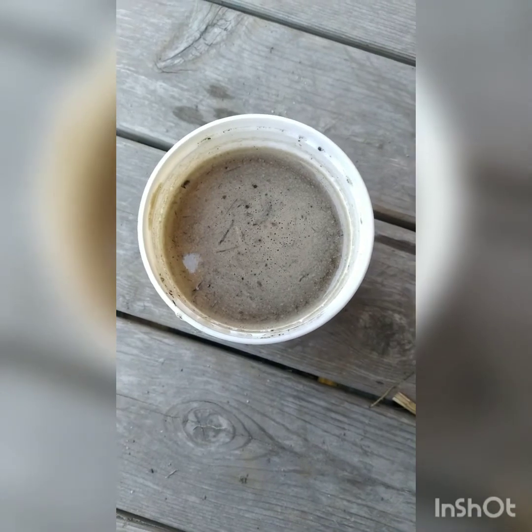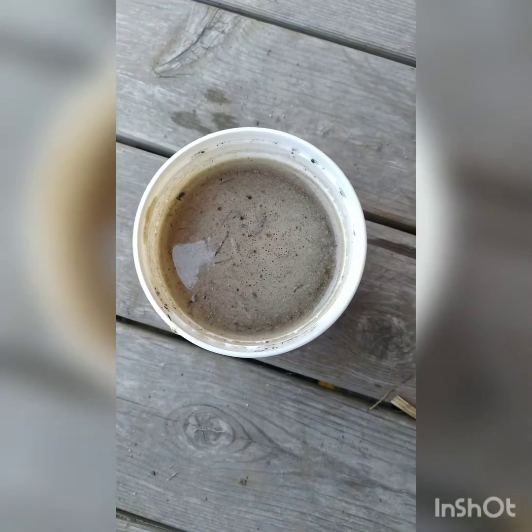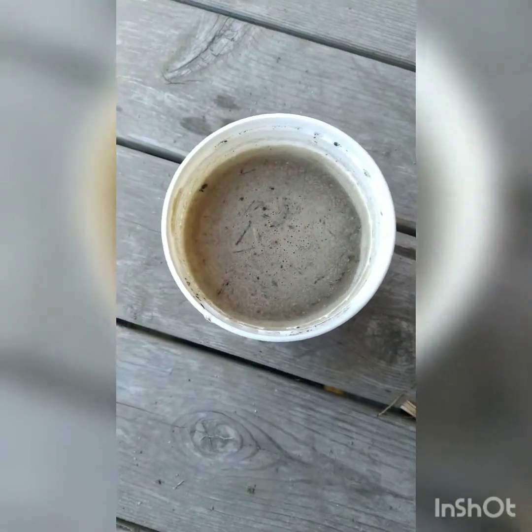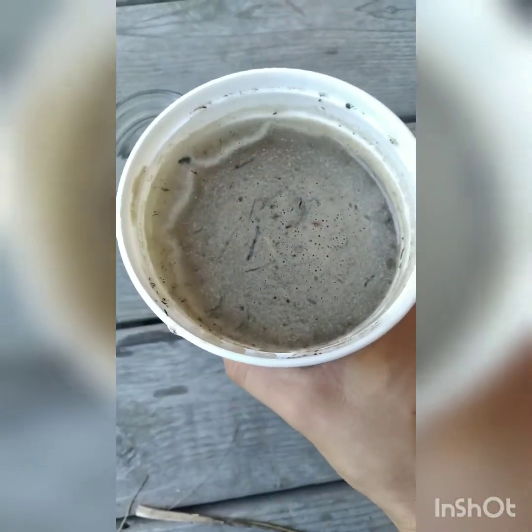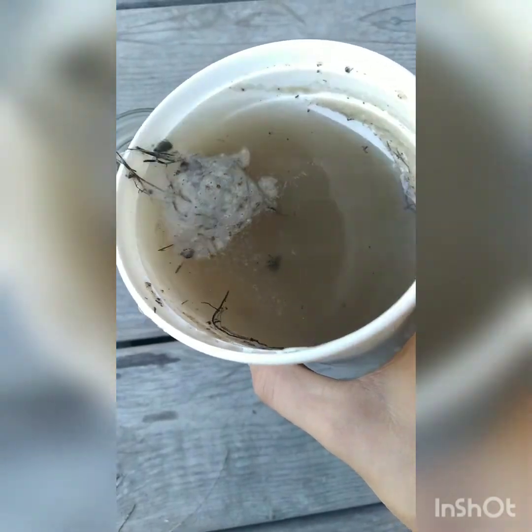My previous attempt to separate the spores ended up with the solution too murky to really use a microscope on, so I tried again using soil with less debris that I had success with finding spores in the past, and I did the whole process again. It should be floating on the top now, and I'm just going to get this white stuff, which is always a good sign — don't quote me on it, but this looks like possibly spores. So we're going to pour it off, along with some bubbles. Try not to get too much of the debris. That looks pretty good — a little more liquid than I would have liked, but we can work with that.